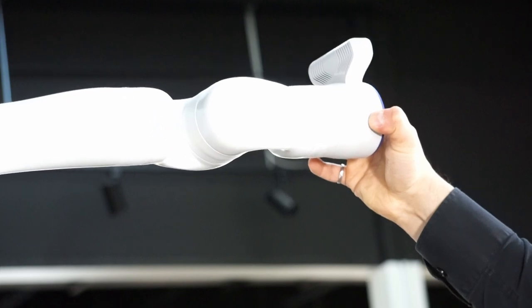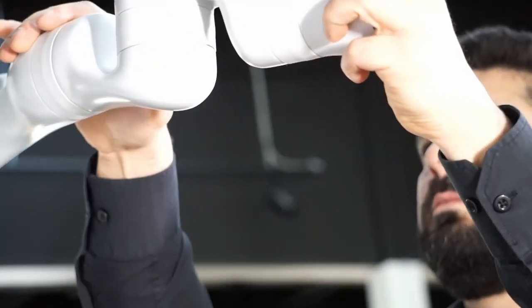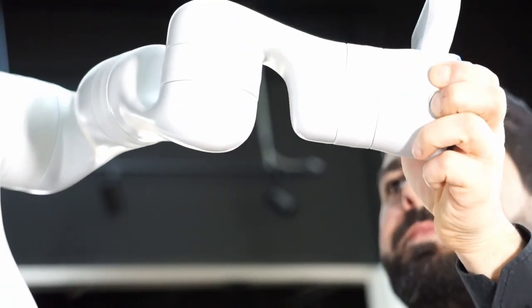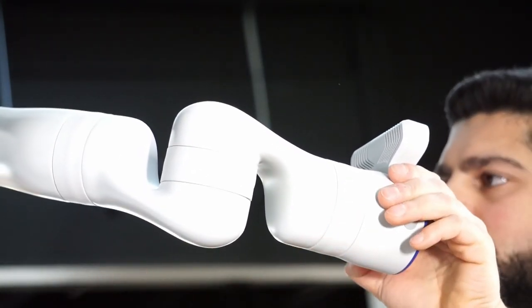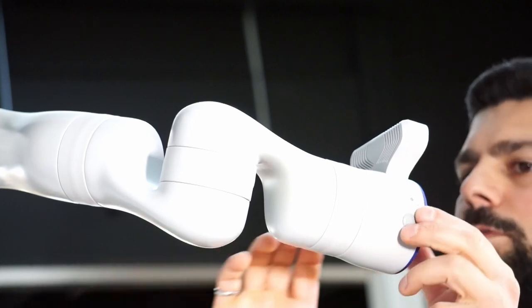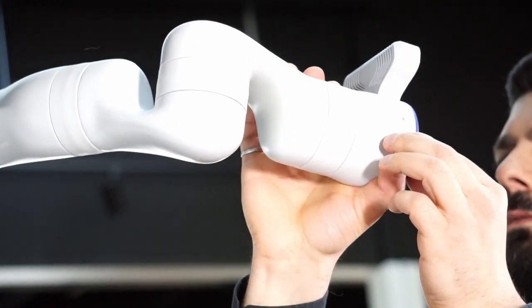For a 7 degrees of freedom robotic arm, when you press and hold the right hand side button, you can control your robot in Cartesian admittance by applying force by hand to move the end effector in translation.